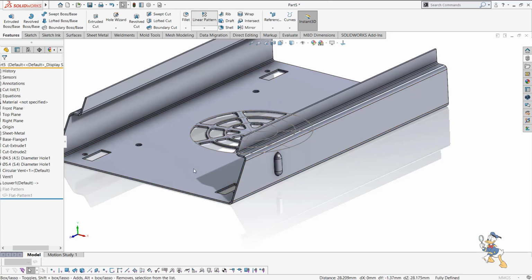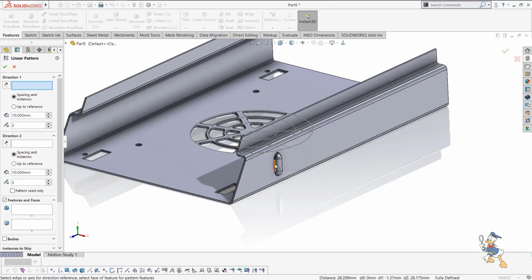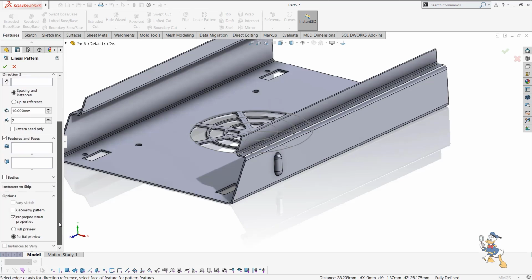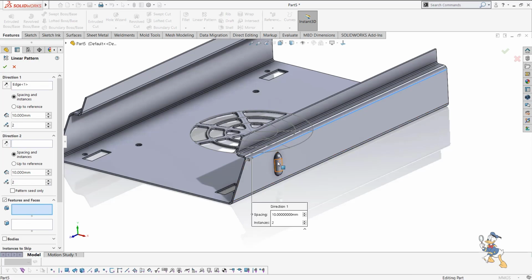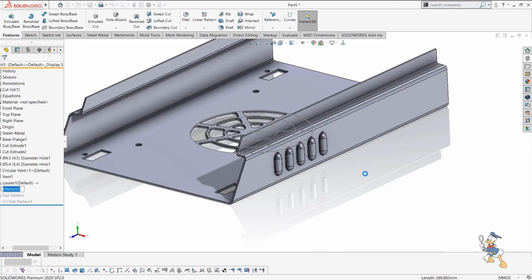If we focus on making our tools in SolidWorks or any design software, it is a very time-consuming process. SolidWorks reduces our time because it is very user-friendly software, and we just need to provide the details in a very simple manner. Like I just need to generate some louvers over here with a pattern distance of 15 mm, and then I just need to check it out. It is very simple to generate this kind of stuff in SolidWorks.